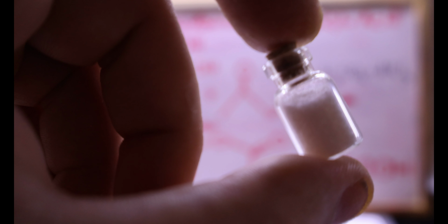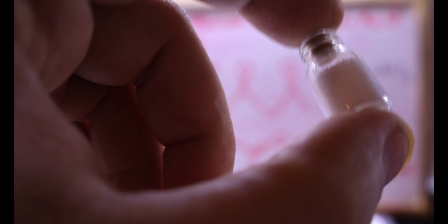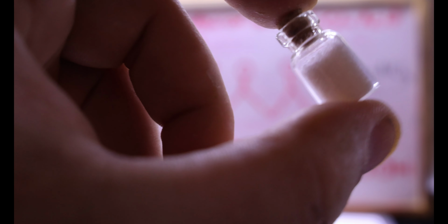I would recrystallize it, but it's just so little, like half a gram, that recrystallization would leave me with almost nothing. I think it's pointless. It's not to be used as medicine or anything. It's just proof of concept. So I will leave it as is and name it crude acetylsalicylic acid.